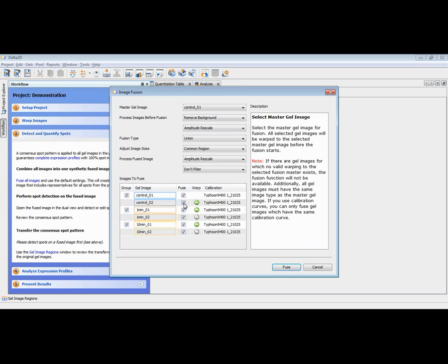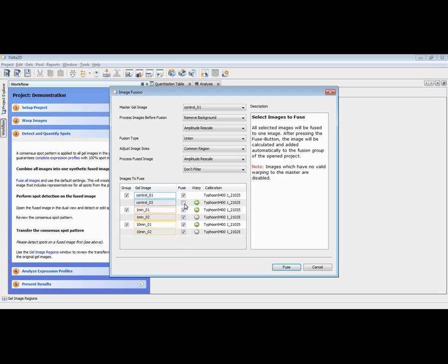So the idea is to fuse as many images as necessary, but as few as possible, to get an image where you collect all the spots. If you are not sure whether control 2 has additional spots compared to control 1, then include it in the fusion. If you know control 1 includes all the spots from the sample and control 2 does not add additional spots to it, then you can exclude the second image from the image fusion.